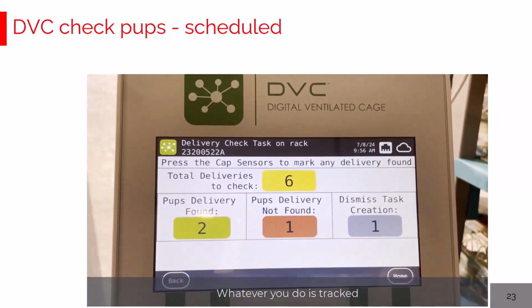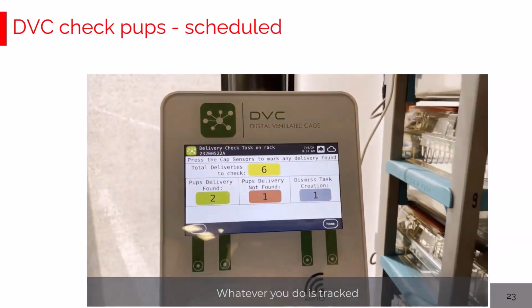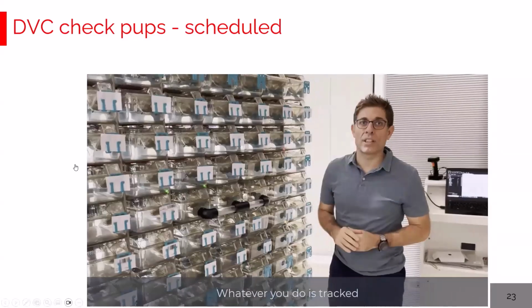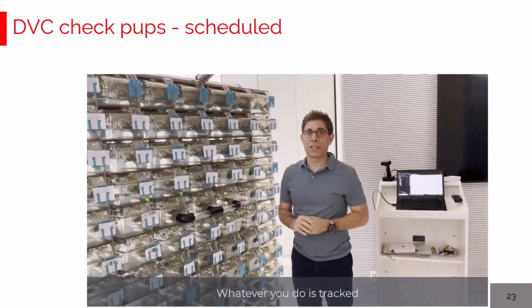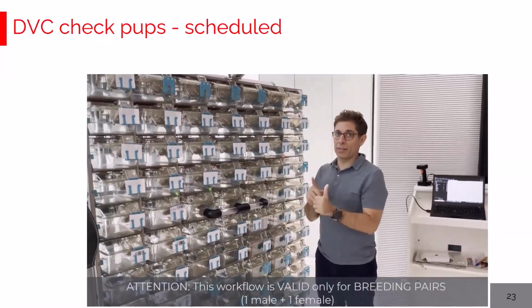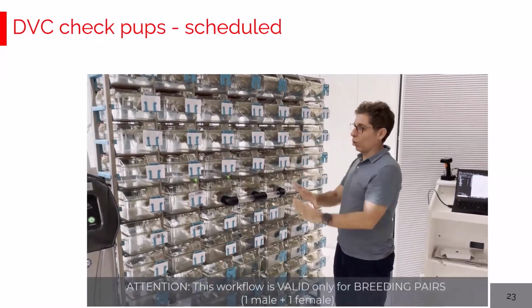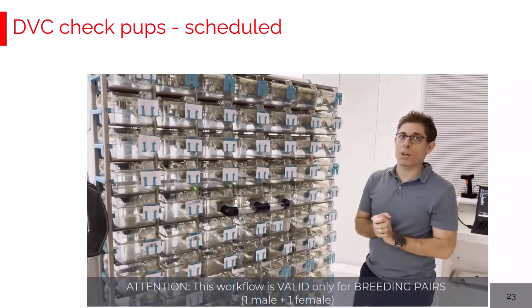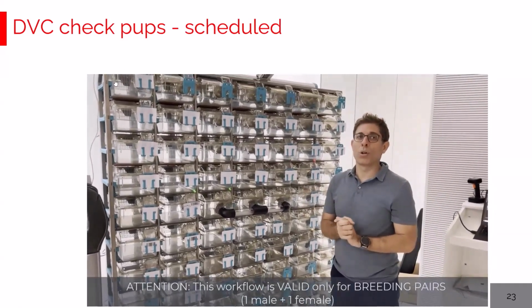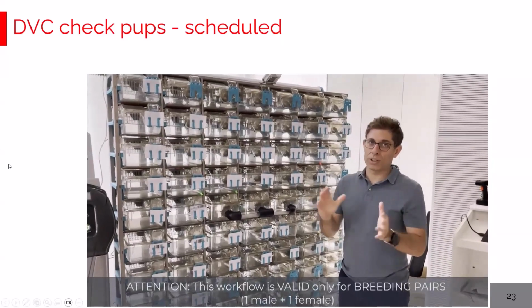So this is the delivery of pups task management with all the different feedbacks. We currently manage the breeding pairs, male and female. All these workflows are currently working for breeding pairs. Thanks to your feedback, we will also look at the breeding trios in the near future.